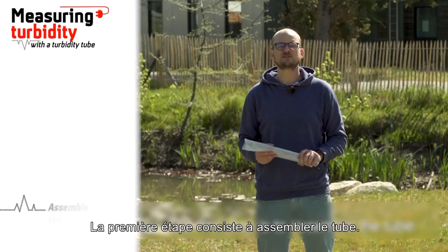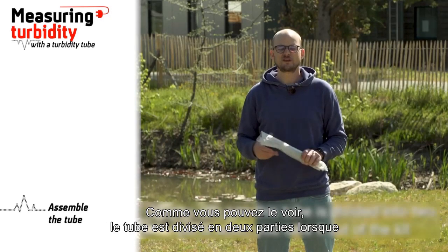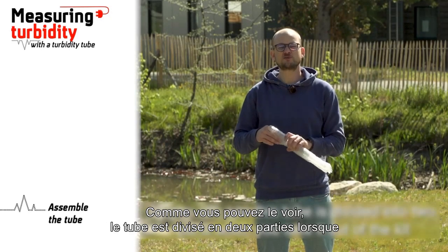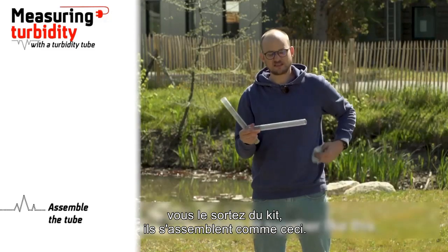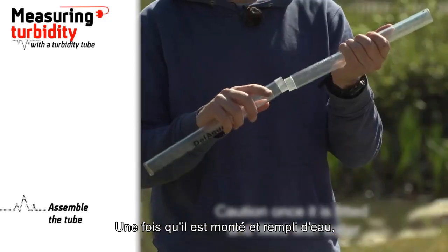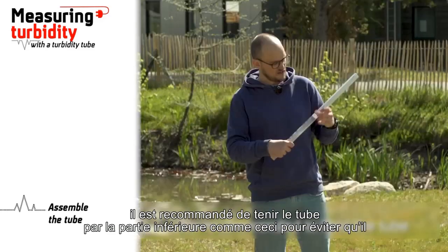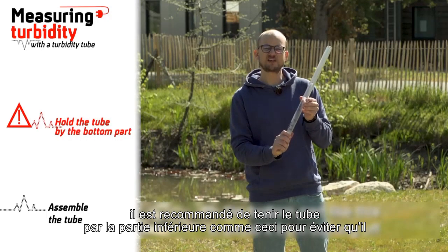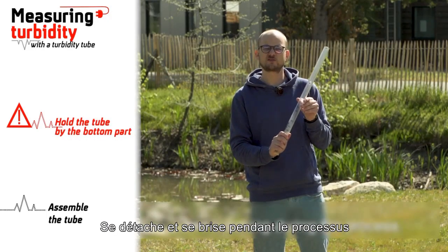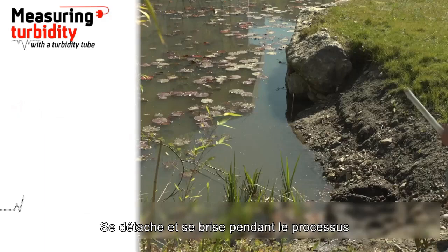The first step is to assemble the tube. As you can see, the tube is divided into 2 parts when you take it out of the kit, which fit together like this. Caution: once it is fitted and filled with water, it is recommended to hold the tube by the bottom part like this, to avoid it coming off and breaking during the process.